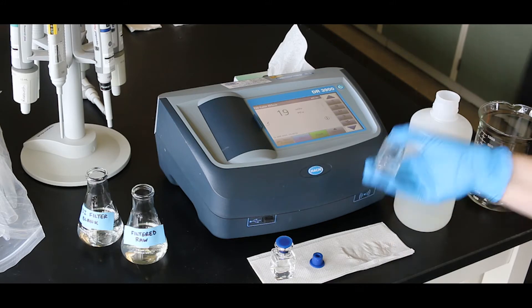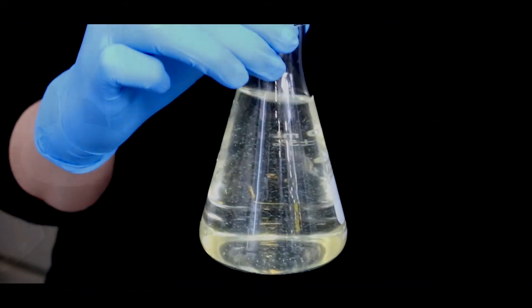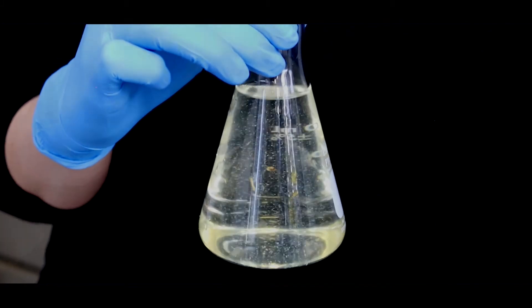Prepare the sample by rinsing and filling with the sample water. Be sure to agitate the sample water if it has been sitting to re-suspend the matter.